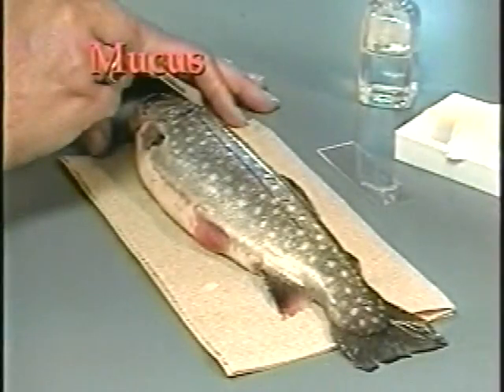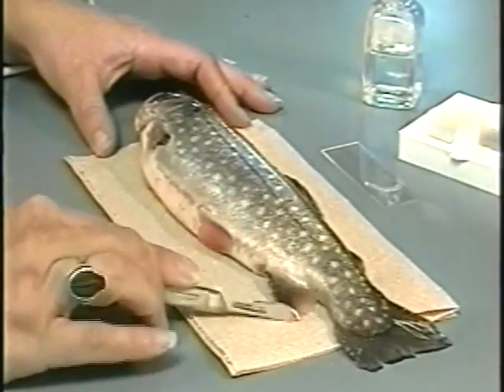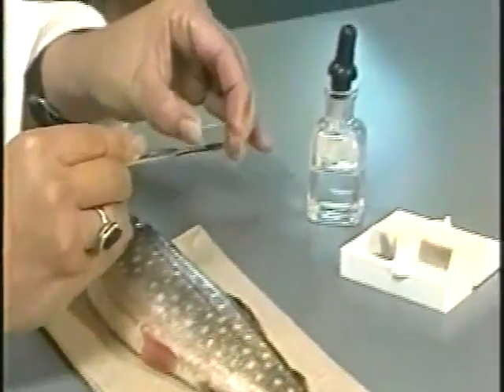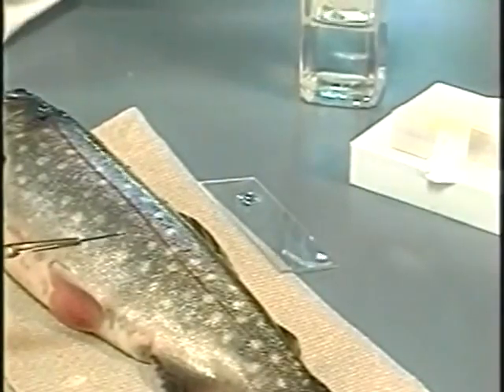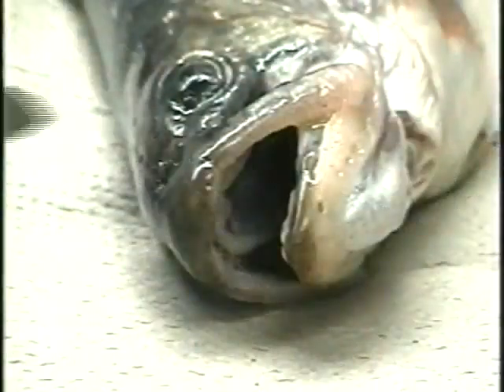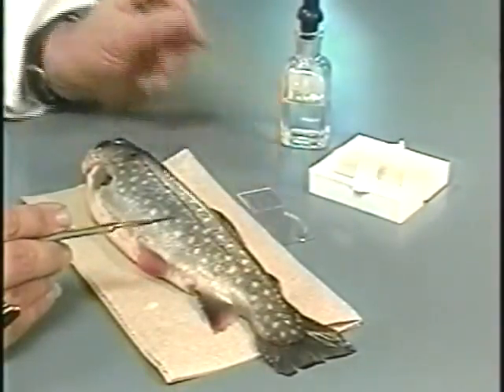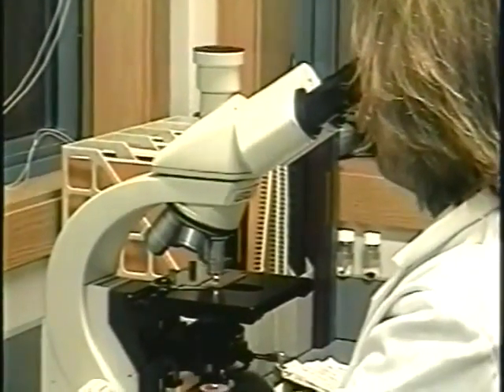Most external parasites can be detected in mucus smears taken from a few sites along the body, including the head, along the lateral line, and the fins. Mucus should be gently scraped using the non-cutting edge of a scalpel and mixed with PBS on a slide. Sample from any area of discoloration or where scales are raised or sloughed. This method can also be used to collect samples from the nares and the oral cavity. Apply a cover slip and examine the sample at 10 to 40x using a compound microscope.